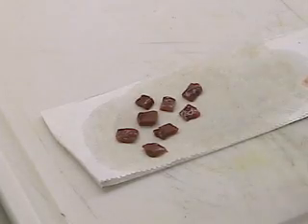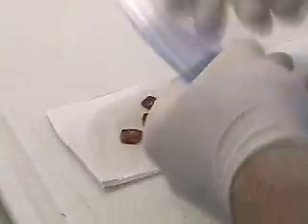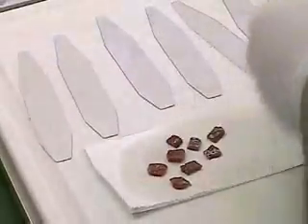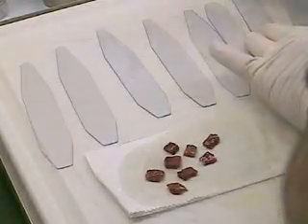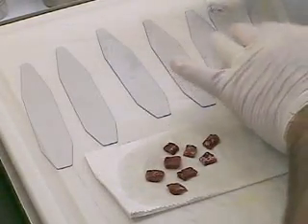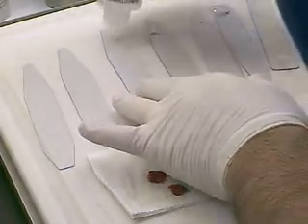First, I'm going to show you how I can embed 8 small pieces of tissue very quickly using this system. I'll just lay down 8 of these dispensing slides, each one getting a little bit of embedding medium. I'm going to be doing this quickly — each piece of tissue will go on one dispensing slide.